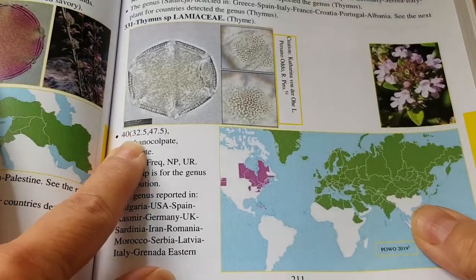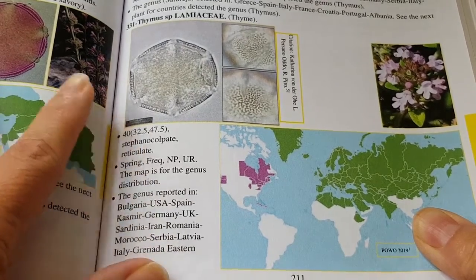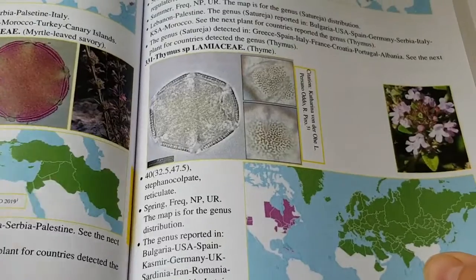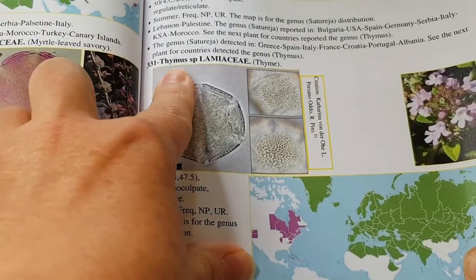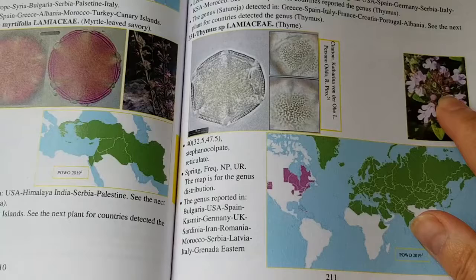The pollen sizes are marked just underneath the pictures of the pollen. The pictures of the pollen are all Mohammed Al-Laban's own images unless otherwise cited. Each pollen has its own allotted number, the Latin name, the genus, and the common name of the plant. There's a photograph of the plant and images showing pollen under a microscope.